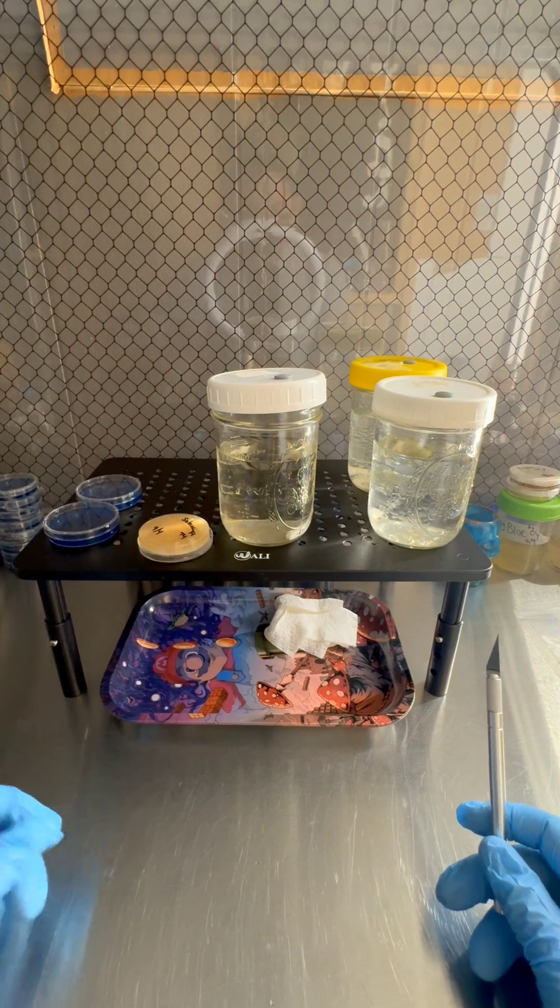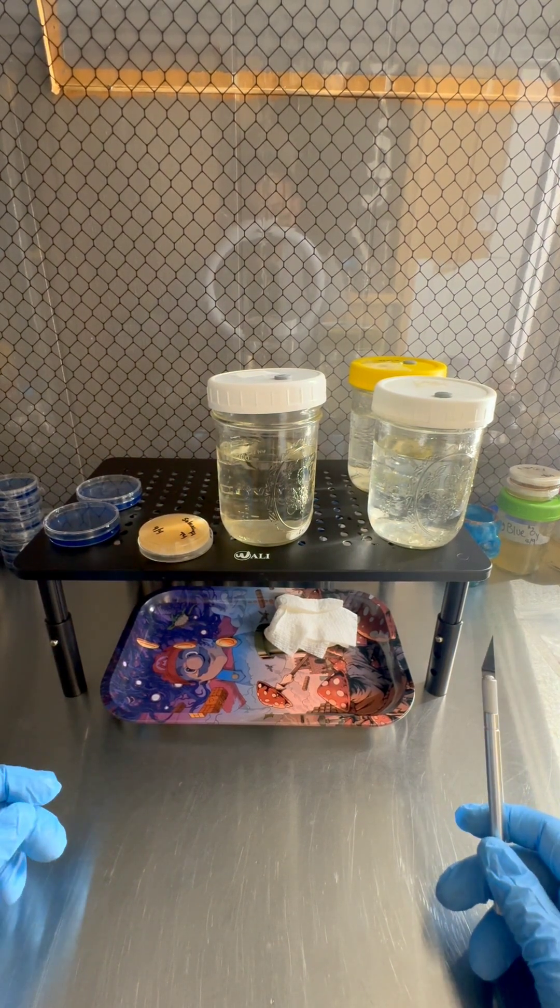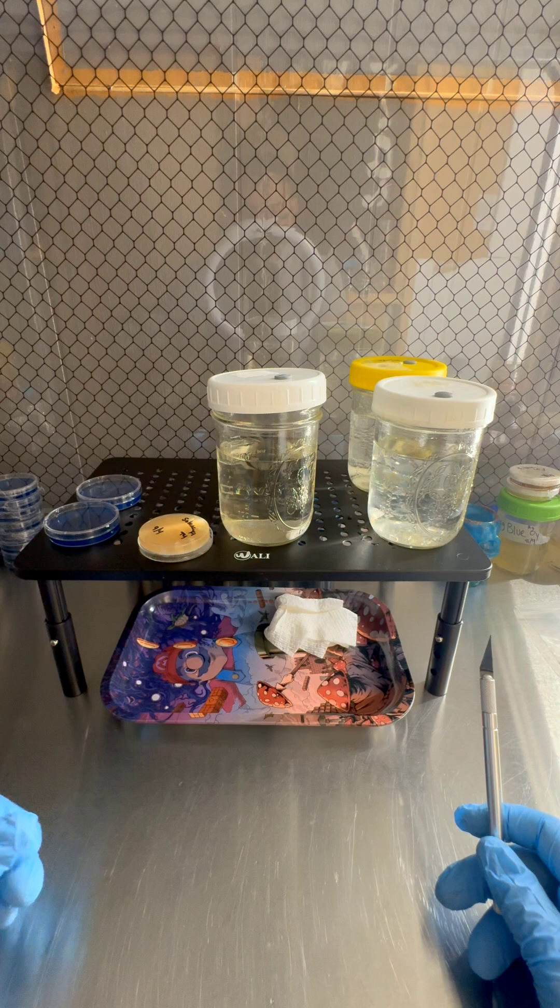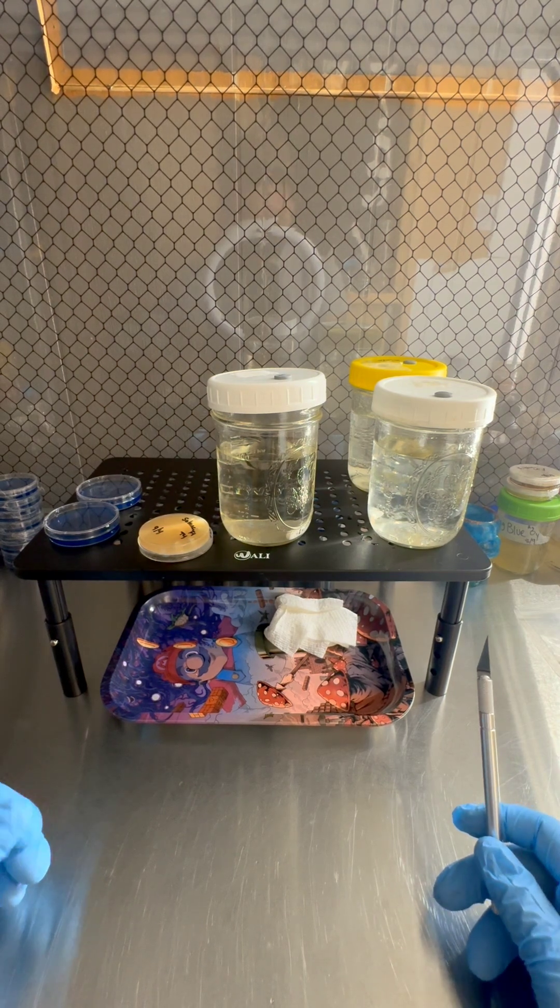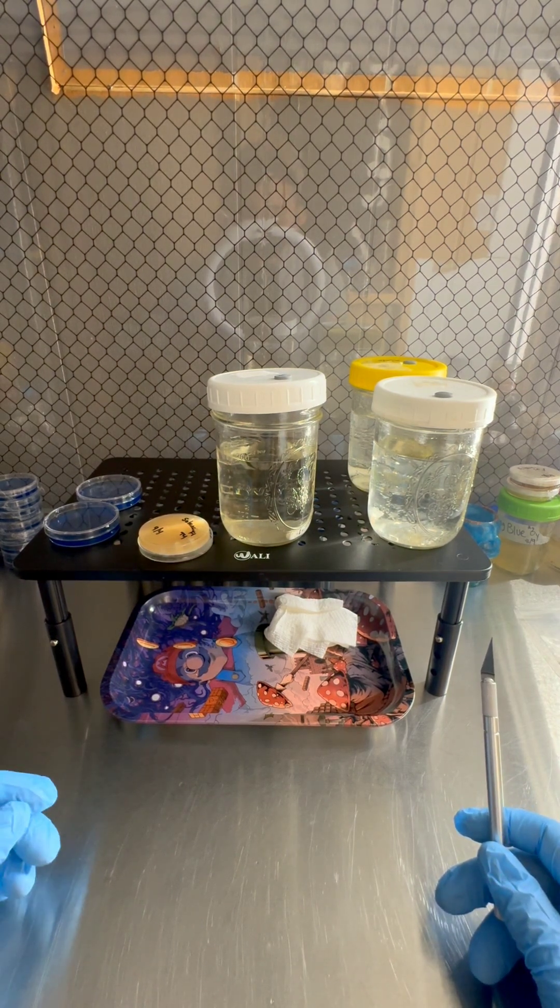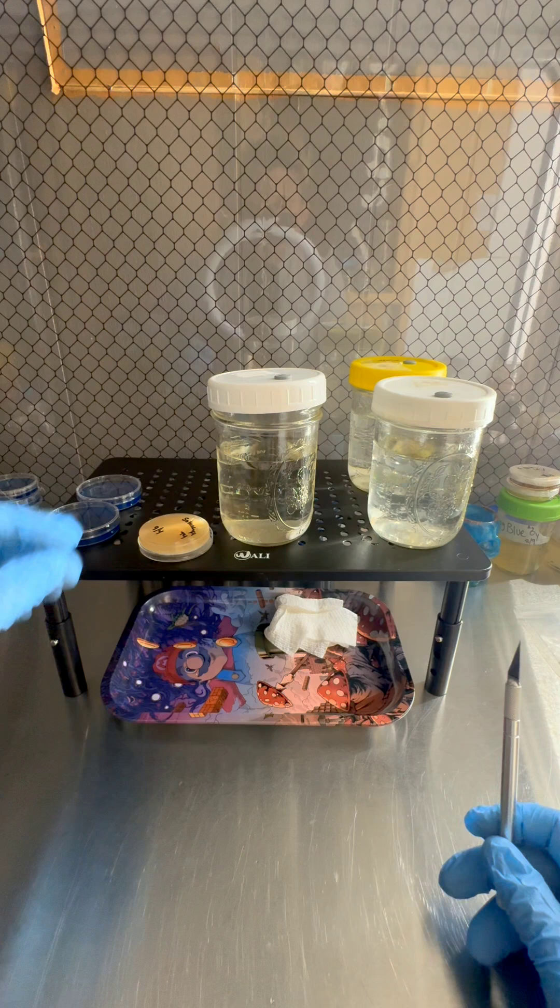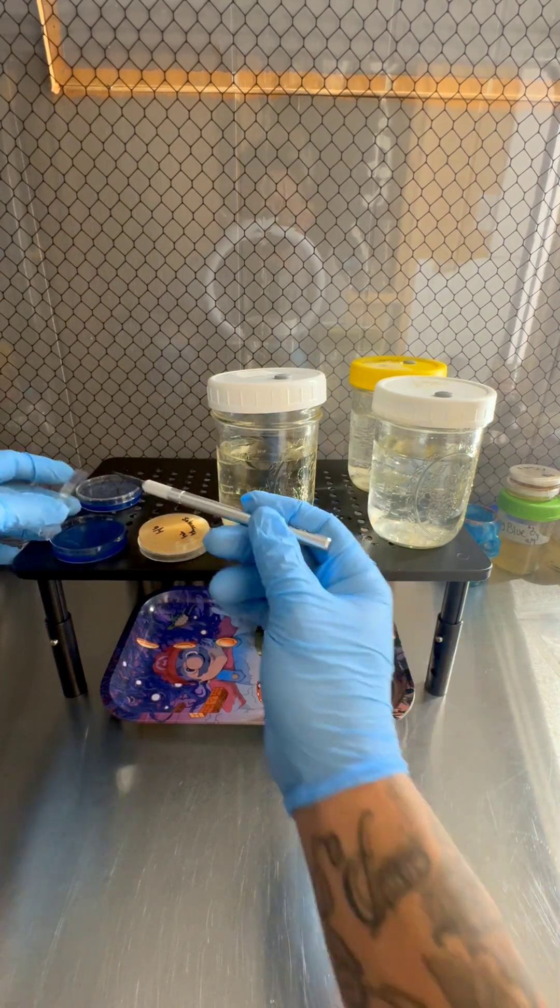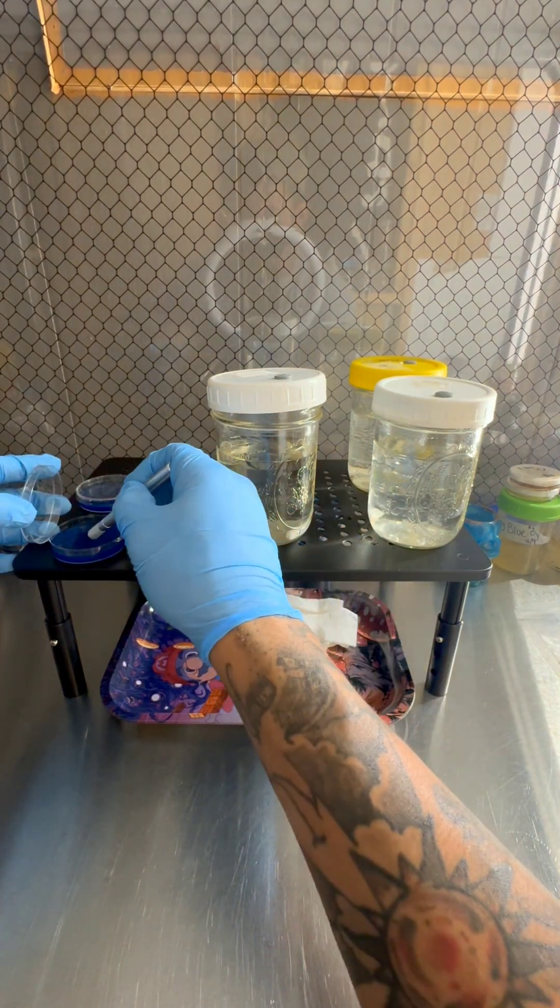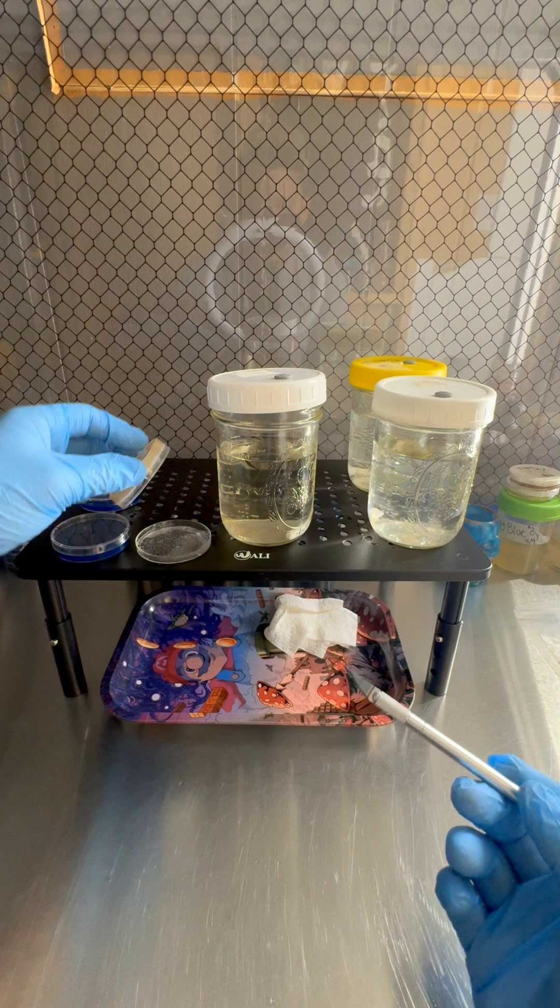Get it red hot. Kill any bacteria that might be on there. This is very simple. I showed y'all this in another video. I'm gonna go ahead and show y'all again. And you want that to cool. Let this cool down. We're just gonna make liquid culture from agar. It's just another way to inoculate your liquid culture. Make sure y'all check out our liquid culture video. Give y'all a good recipe on how to get some strong thick liquid culture. Let's just double check. Make sure this is cool. Putting it on the empty plate.